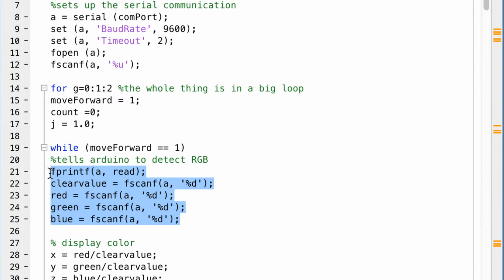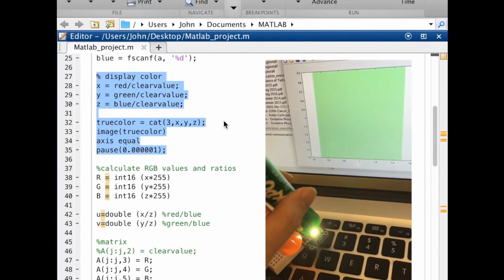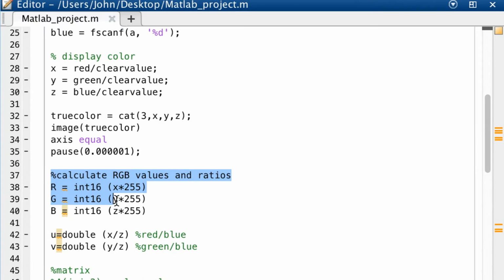This part, from line 20 to 25, tells the Arduino to detect the color clear, red, green, and blue, respectively. Lines 27 to 35 are used to display the color that the color sensor detects on the computer's screen. This part of the code is used to calculate the RGB values and the ratio of red to blue and green to blue. By taking the ratio of the other colors to blue, we can cut out the background light and obtain a better signal to noise. This allows us to clearly measure what is changing when we stretch the film.